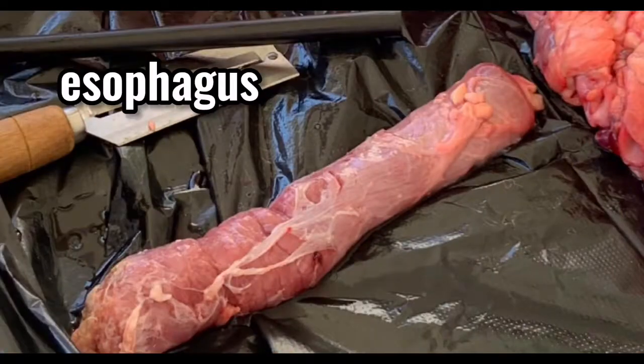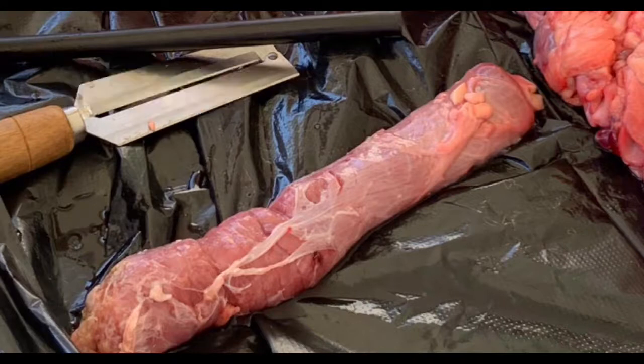Esophagus. Now the esophagus. This structure is important because it transports saliva, liquids, and foods from the mouth to the stomach. The esophagus runs behind the windpipe and heart. During swallowing, the food goes in here because the epiglottis tilts backwards to prevent food from going down the larynx and lungs.